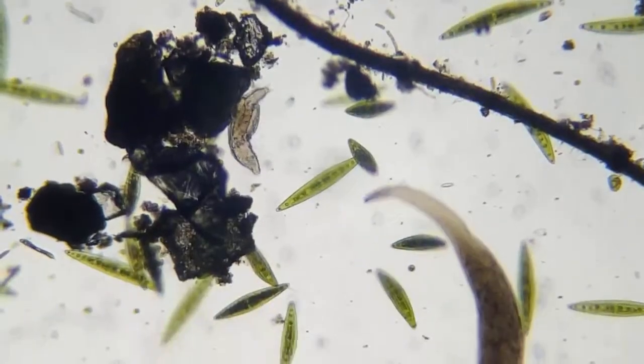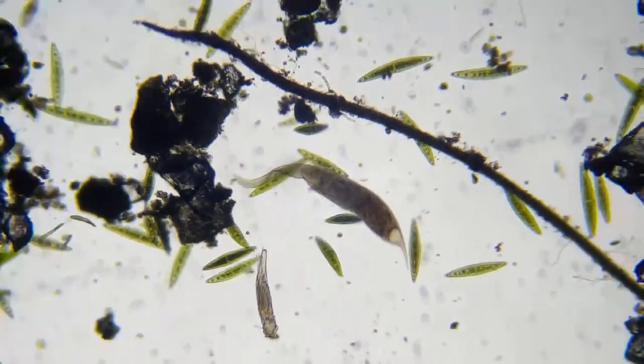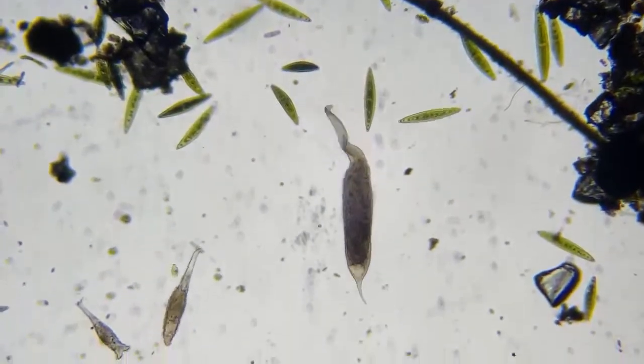Thanks, Motino. So it looks good. Oh, here comes my guy. That's what I was looking for. This is a Dileptus, and he's looking good today.